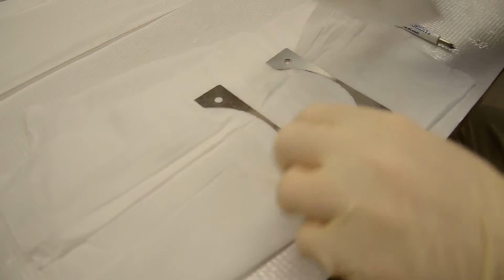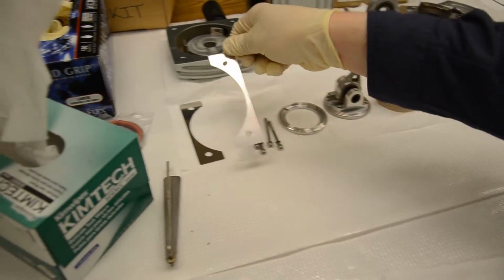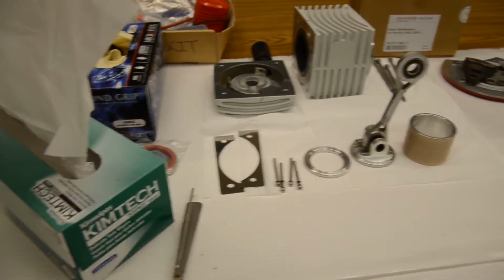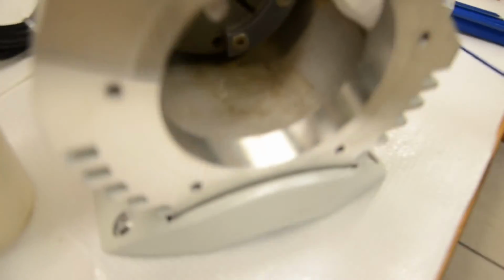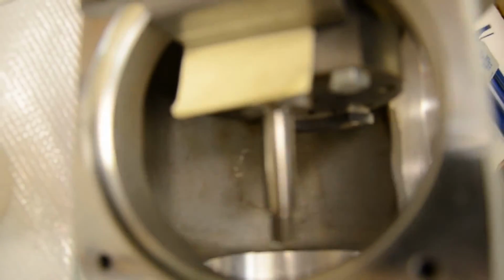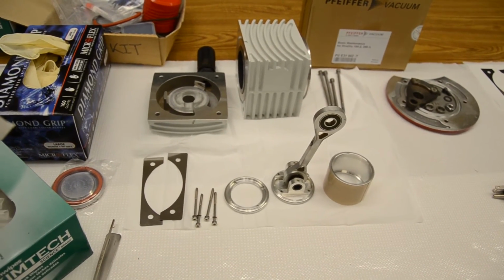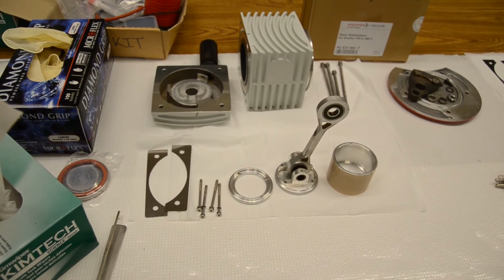As I said, the most important piece with these is maintaining their orientation and which side they belong to, because they're not always identical, either on the side of the piston or on the actual pump itself. So as you can see, we have a clean assembly cavity. And we have a full set of clean piston components, at least for the left side. The procedures are all the same for both sides, so there's no need for us to show you the right side. And we'll see you again during assembly.